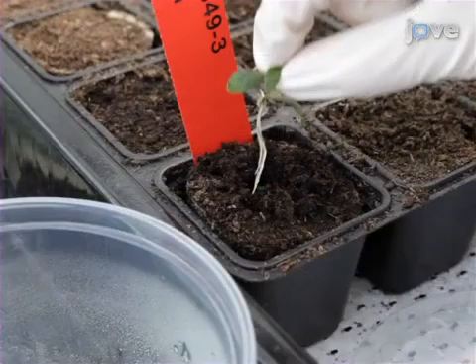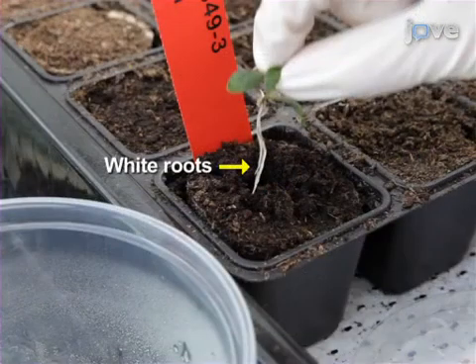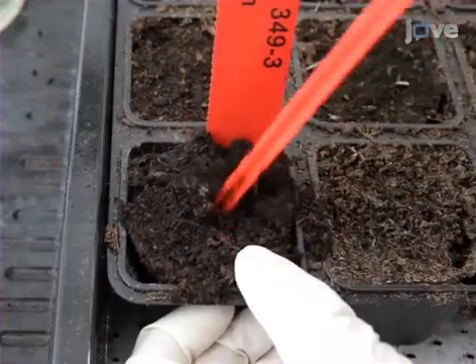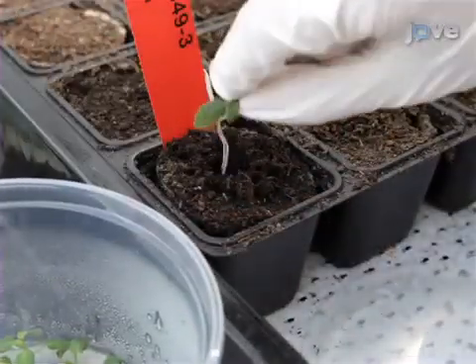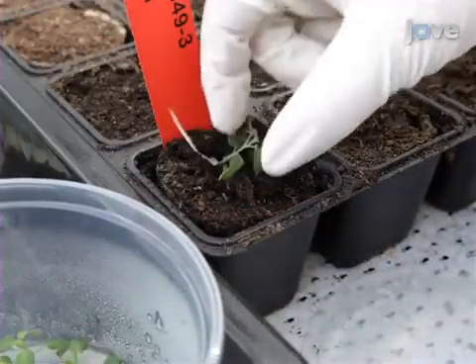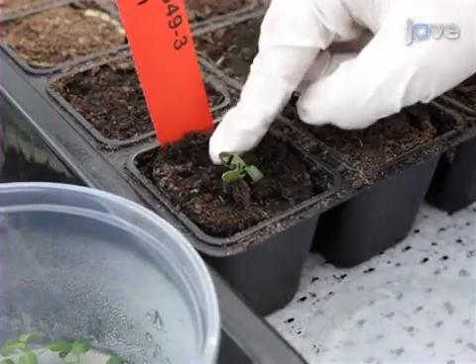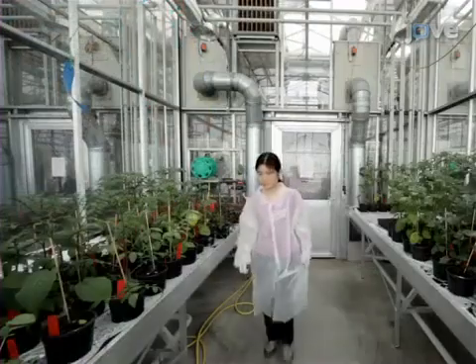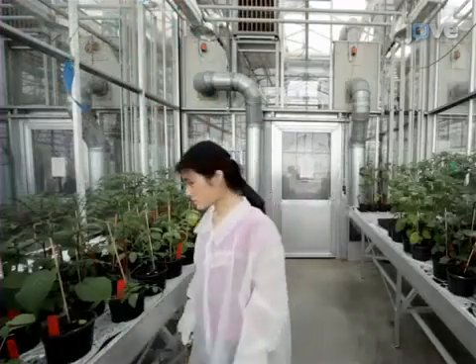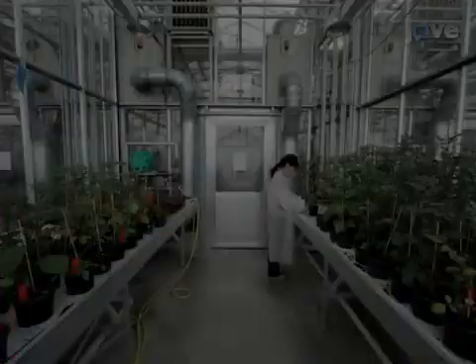When plants grow white roots, transfer them into pots of sterilized soil in regulated greenhouse compartments. For plants used in these experiments, use four to five week old seed-grown Nicotiana.